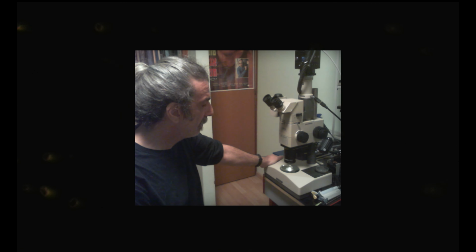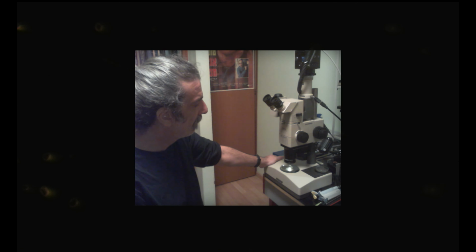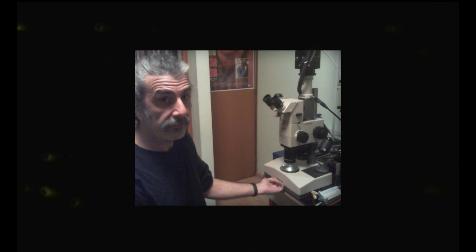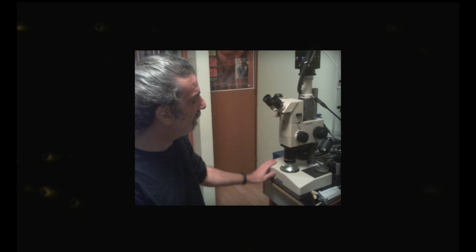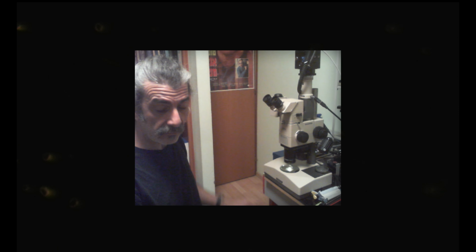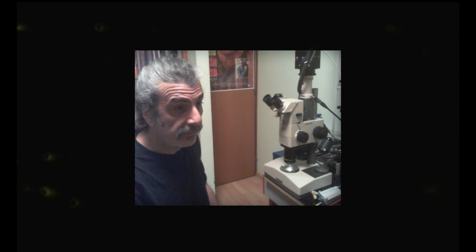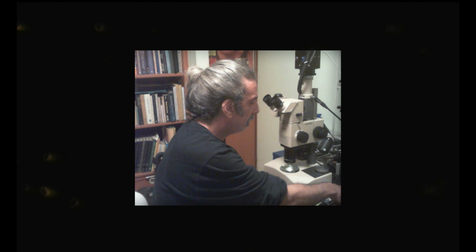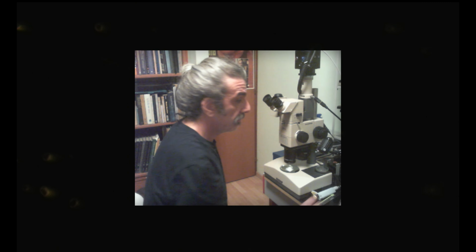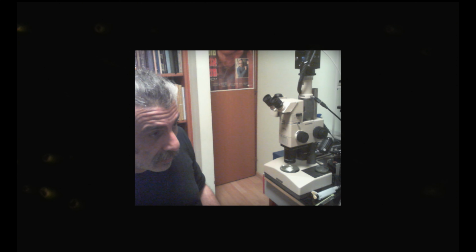The microscope sits on an illumination base. The light comes from beneath. This is very important. We'll see how it affects our ability to recognize specimens. And I start by doing a little show off of what we can do. So I'm turning the light all the way.